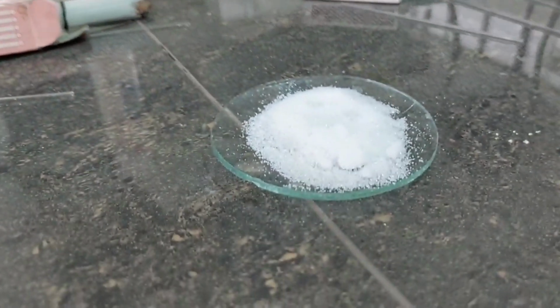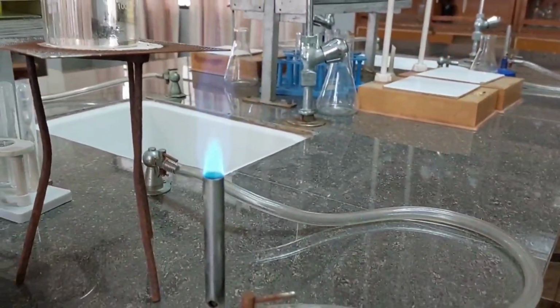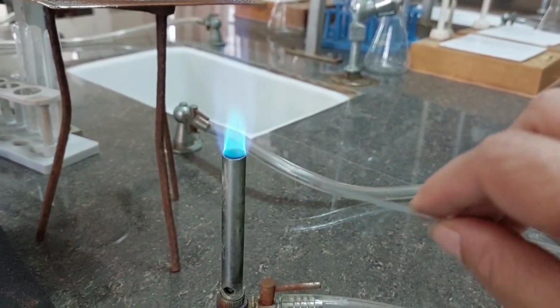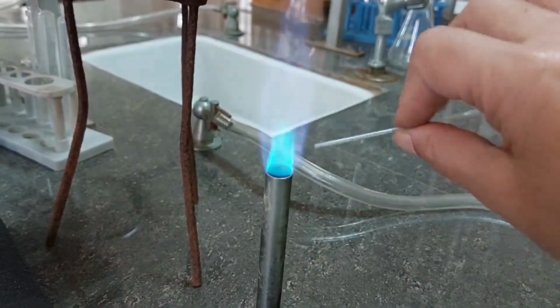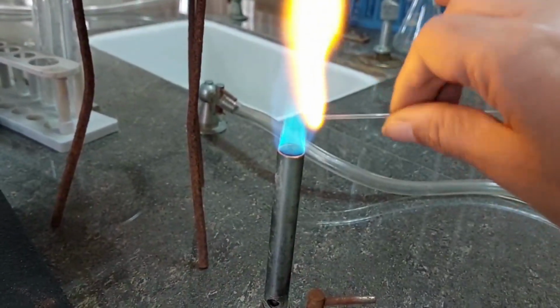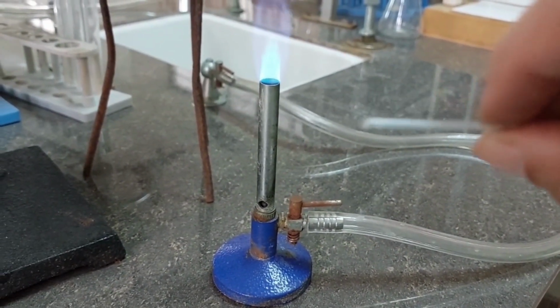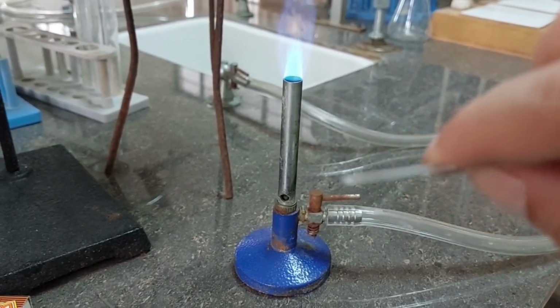This is the organic compound in a watch glass. So I am going to heat this capillary tube. I have this capillary with its both ends open. So I'll be closing one end of this tube by heating it in the flame. Keep swirling so that a bulb is formed but it doesn't bend at that end. So you can see one end has fused. So I'm going to use this fused capillary tube. Must make sure it is fused properly.